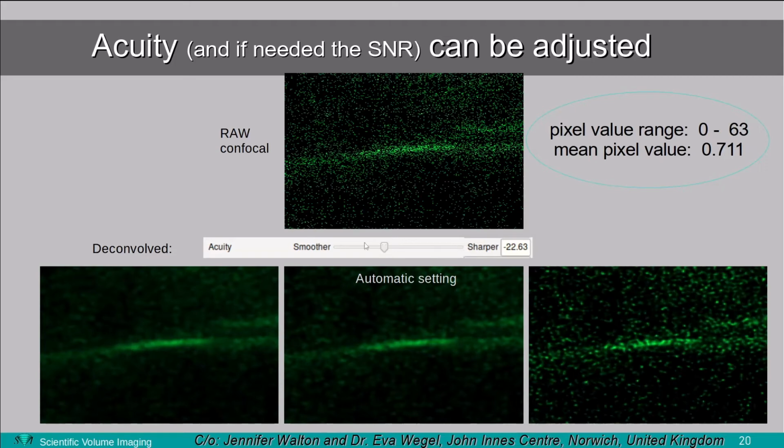And here we see that by using the slider, pushing it to the left, we get a smoother result with deconvolution. In the center, there's the automated Huygens setting, and this gives a great result. And at the right, we see a sharper image, and this can create some noise enhancement. So you should be careful with this. But the default settings here, the automated settings, are fine.